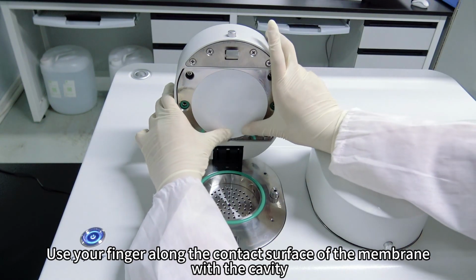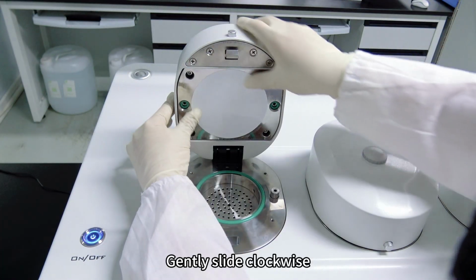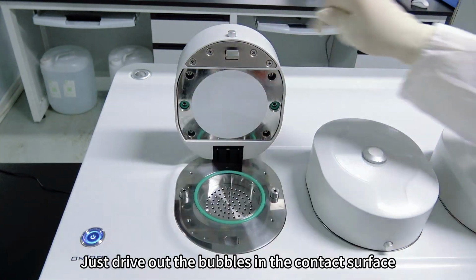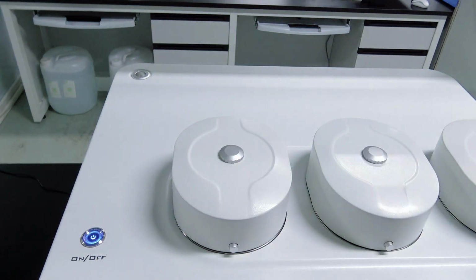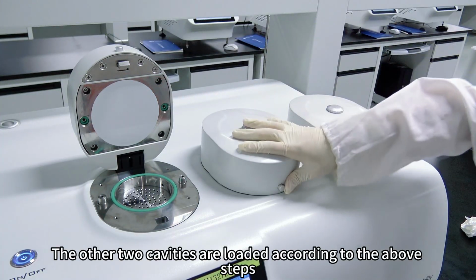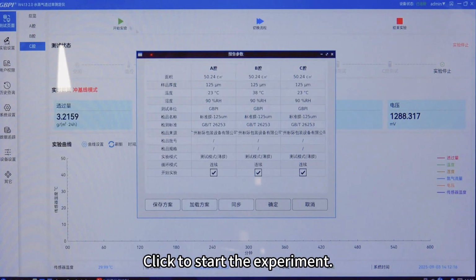Use your finger along the contact surface of the membrane with the cavity. Gently slide clockwise to drive out the bubbles in the contact surface. Cover the upper cavity cover. The other 2 cavities are loaded according to the above steps. Click to start the experiment.